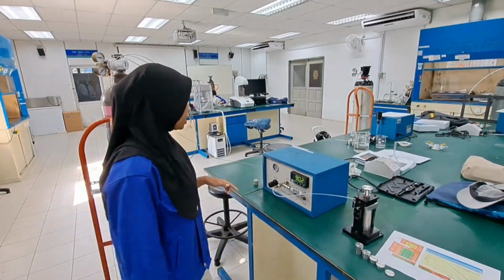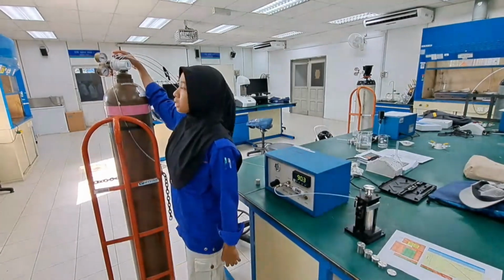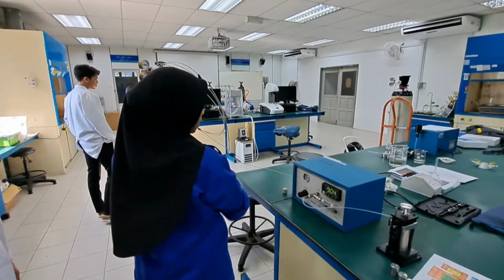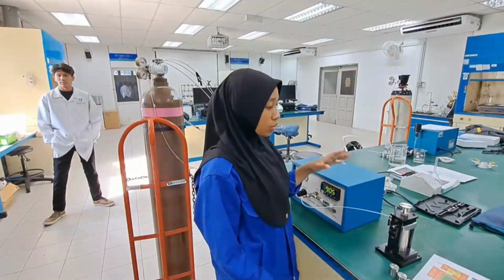Okay, we have to turn off the gas. To make sure the gas is out, you need to open this.